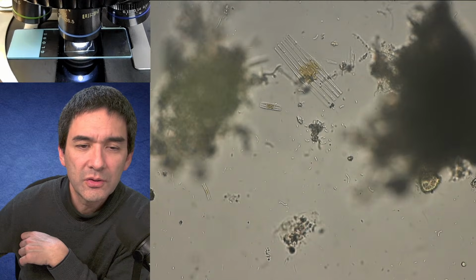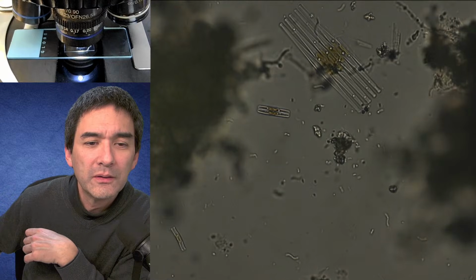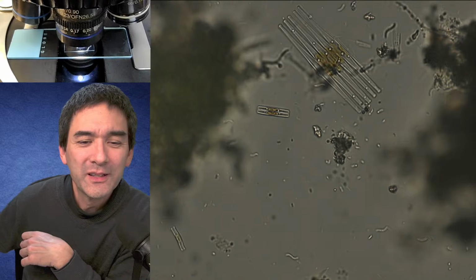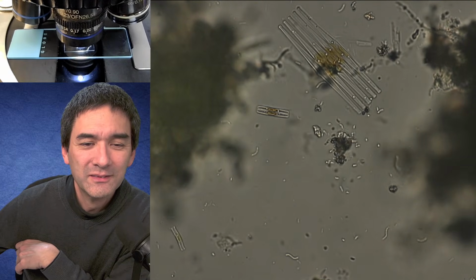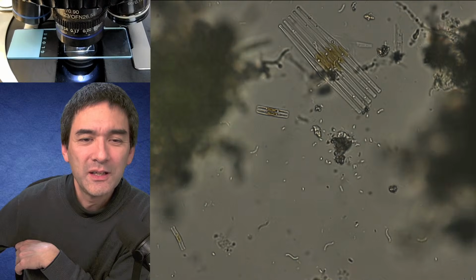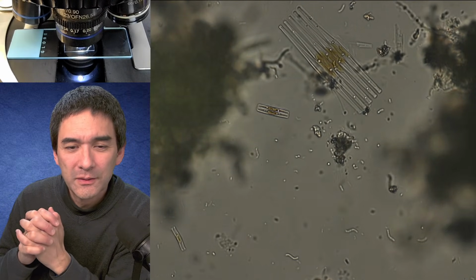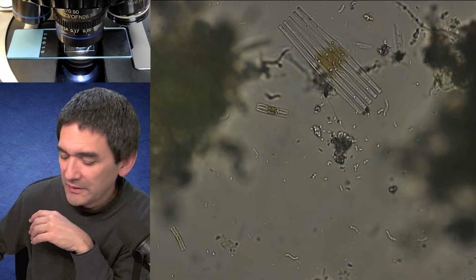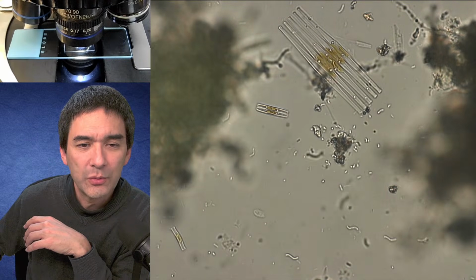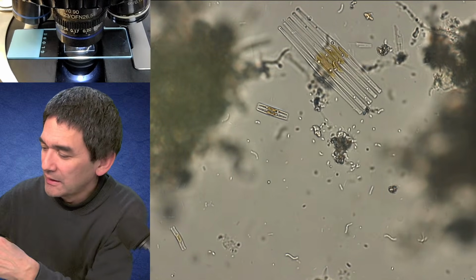Oh, look at this. This is actually quite nice. By the way, this is still bright field. So let's try 60 times. Wow! Look, bacteria, spiral-shaped bacteria, spirilla. So you see there's quite a bit going on here. Let's see if we're able to see that level of detail with the other microscope. Let's go up here a little bit.